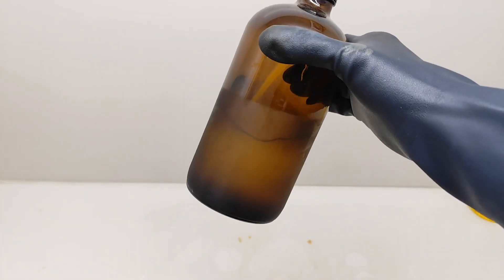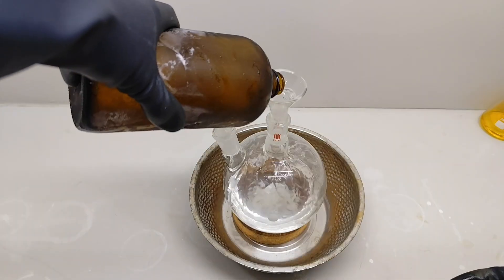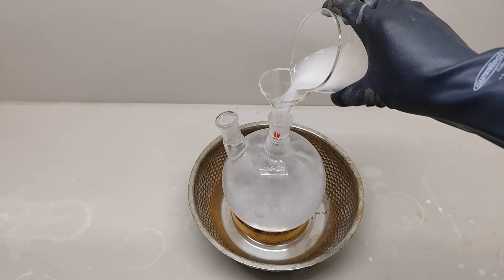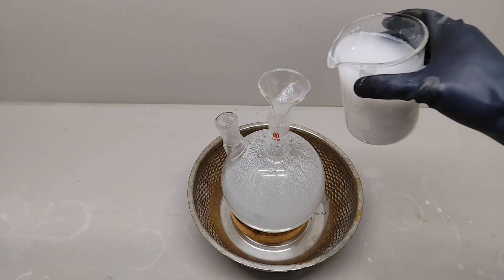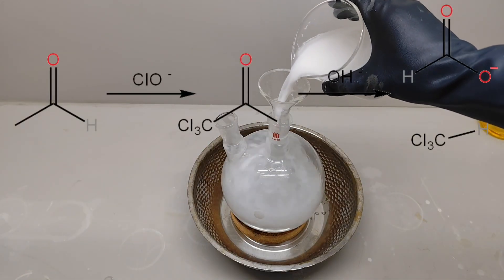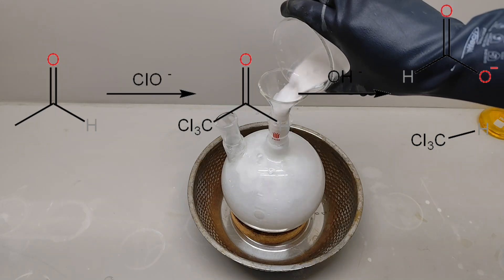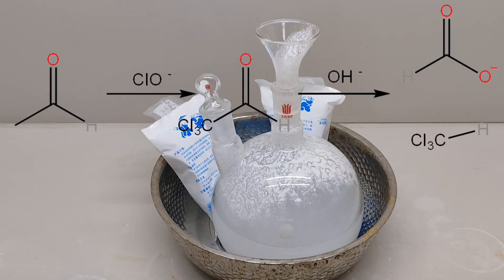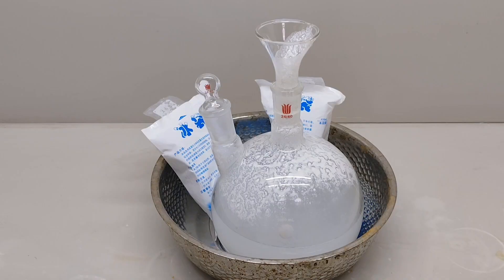To start the haloform reaction, I pour all the acetaldehyde into a very concentrated sodium hypochlorite solution, which was made by reacting cold, concentrated sodium carbonate solution with calcium hypochlorite solution. There are two steps in the haloform reaction. To complete both in one step, sodium hydroxide is also added to drive the second step. The setup is placed in an ice bath and kept overnight to ensure the reaction is completely done.